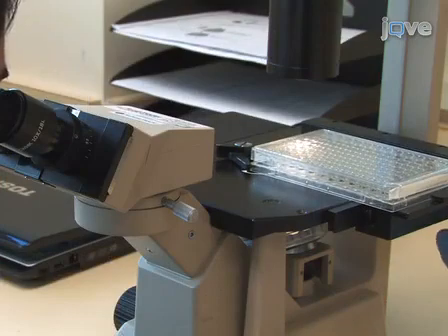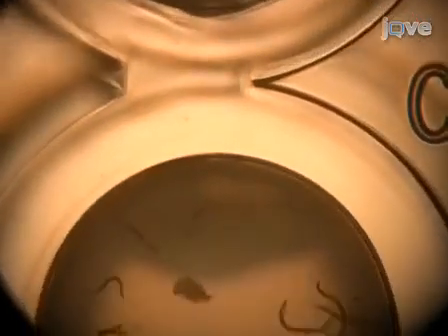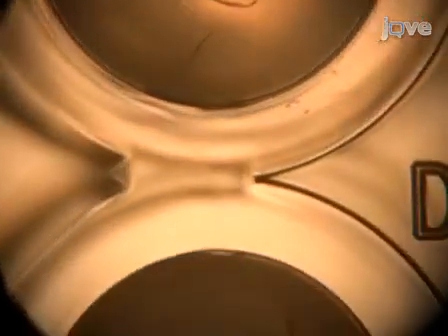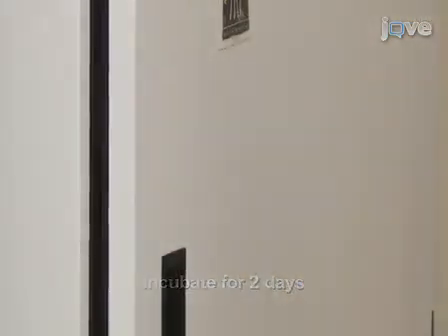Adding the drugs can occasionally kill a few animals per plate, especially if using a solvent other than water. Use an inverted microscope to check for dead animals. Generally, there should be less than 10 dead animals per 96 well plate. Return plates to the 20 degrees Celsius incubator for 2 days.